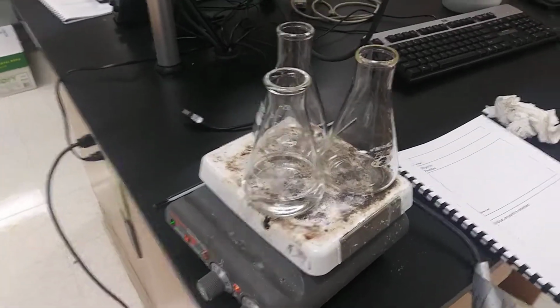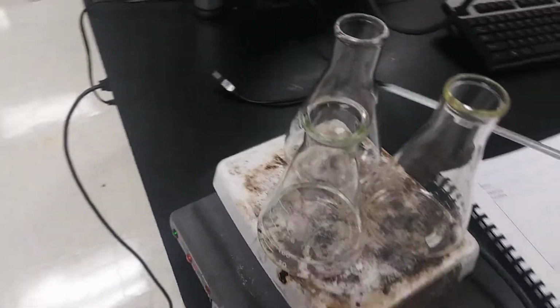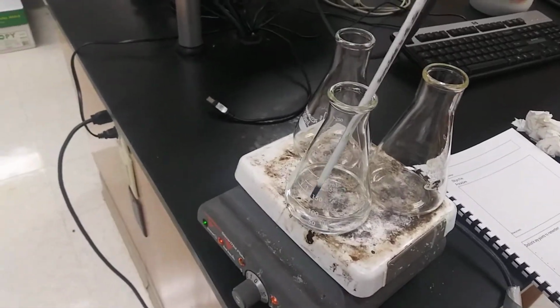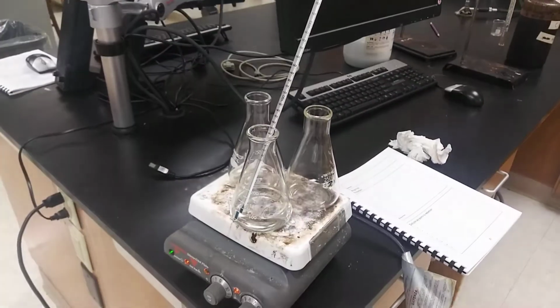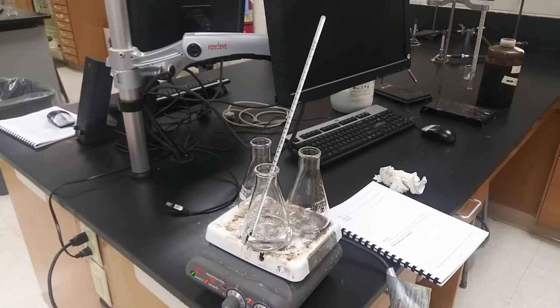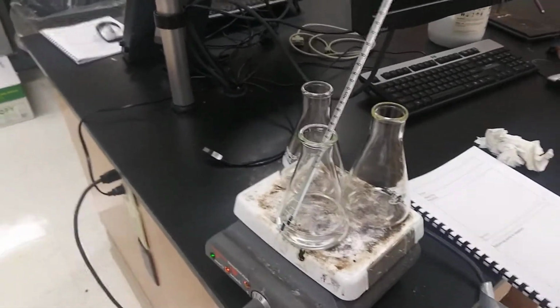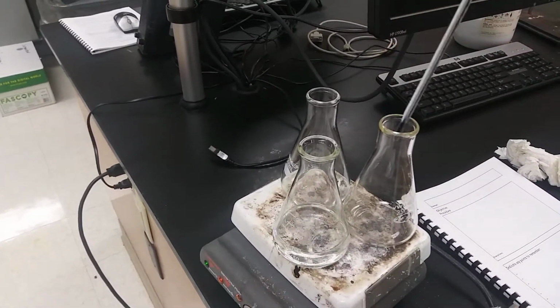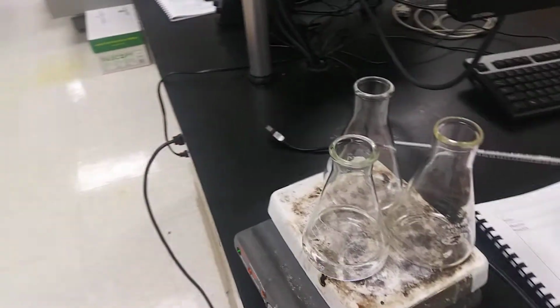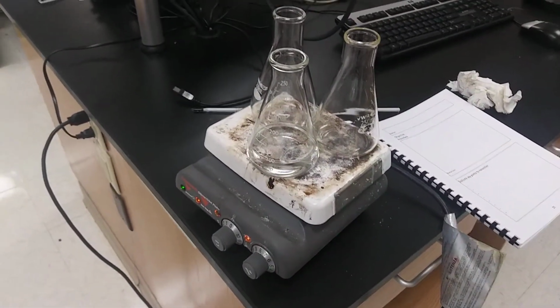So one thing I mentioned, I don't have any liquids in these guys, but I have everything in there ready to go. And I see quite often a thermometer hanging out the top of this thing. And I always got to tell kids, this here is just an exercise in something being spilled. So just a quick heads up that while it's heating, you can just measure your temperatures, and then take them off. We're trying to get to a certain temperature. I think it's like 70 degrees.